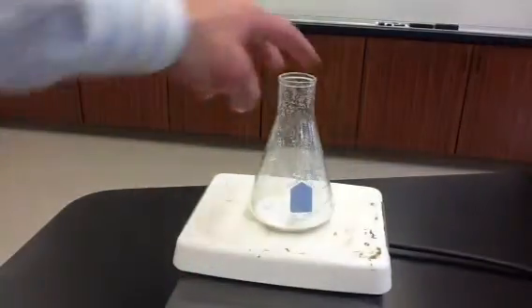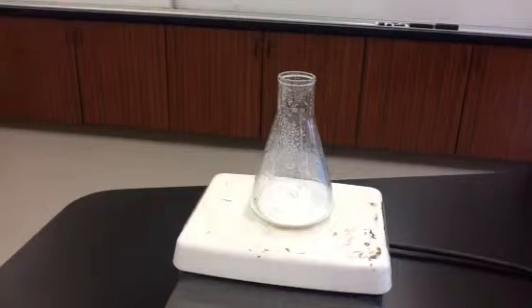For our next reaction, I already started this one a little bit earlier. And it's over here on the hot plate. This is sodium bicarbonate. Another name for that is baking soda. And the sodium bicarbonate has been heated on a hot plate.